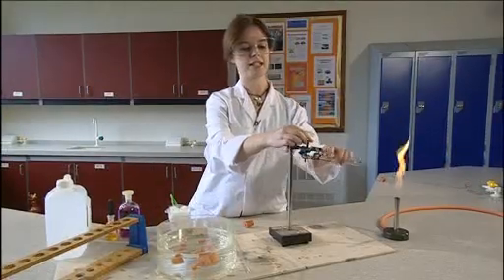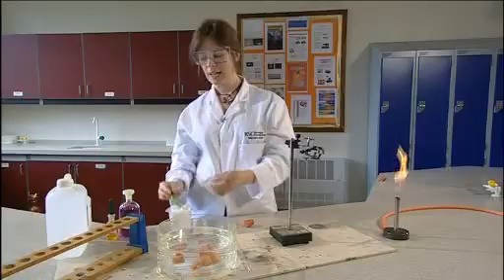The experiment is carried out in a boiling tube and you need to start by putting some mineral wool, not cotton wool, into the bottom of the tube.